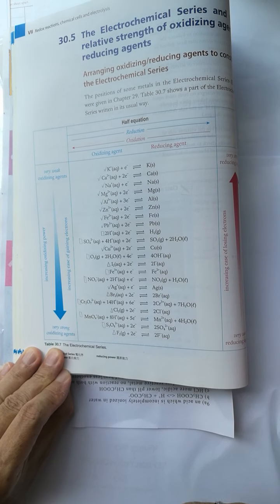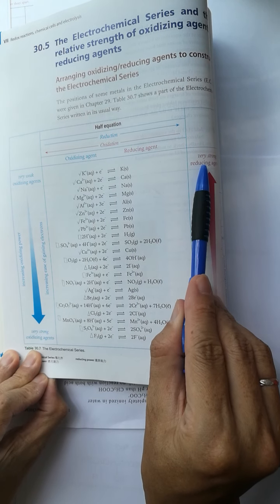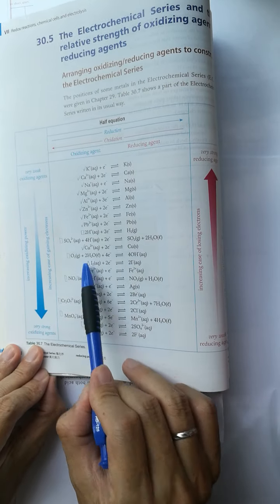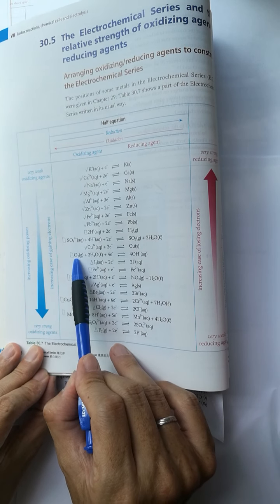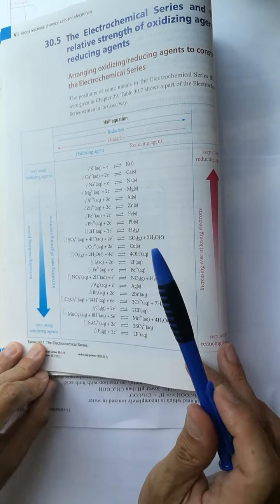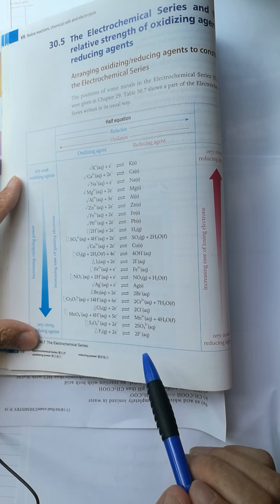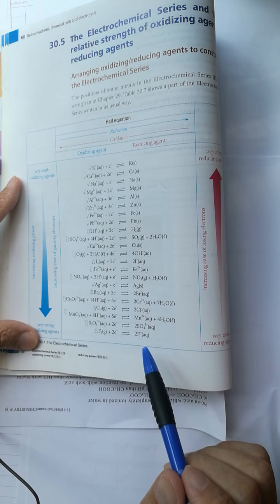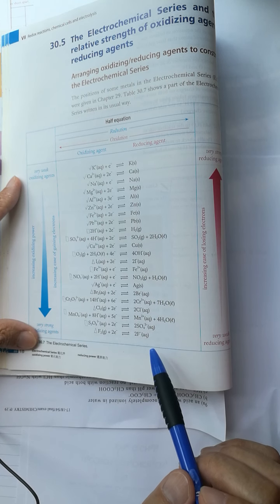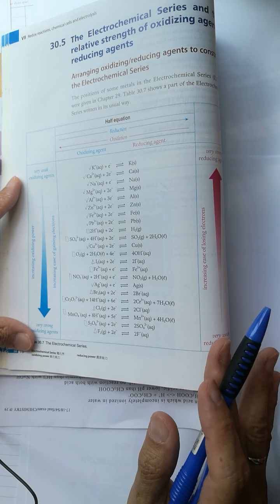As you can see from the electrochemical series table, the hydroxide ion is a stronger reducing agent than the sulfate ion, so the hydroxide ion loses electrons forming four electrons, two water molecules, and one oxygen molecule. However, in previous experiments the electrodes used were graphite or platinum — both inert — meaning they do not take part in the reaction.